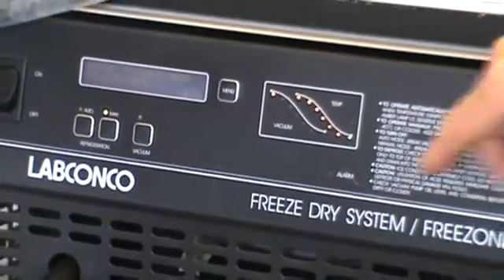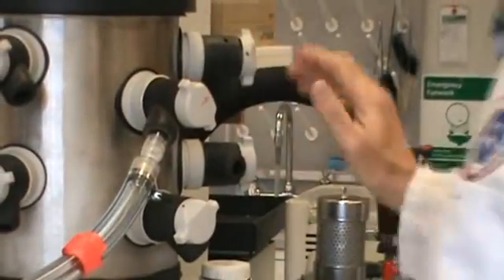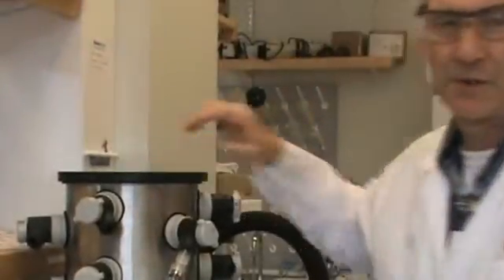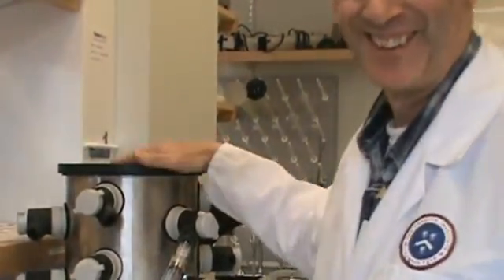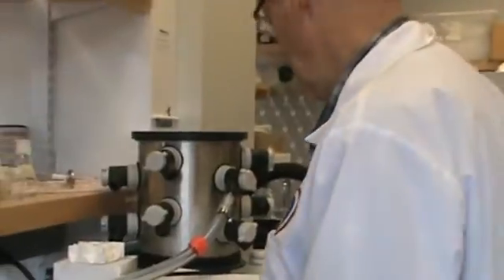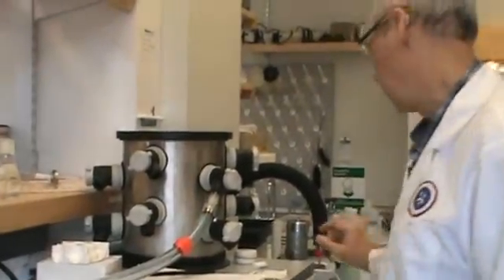So now the temperature is down low. This is sealed, and there's a little water in here because I forgot to dry it off first. So it's just a demo. Make sure the water is out of your chamber first to the pump.